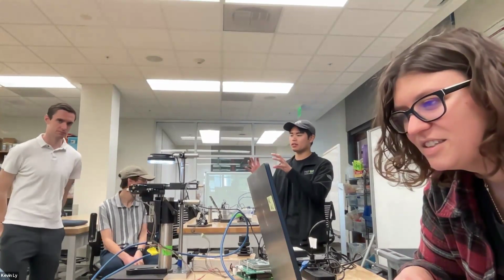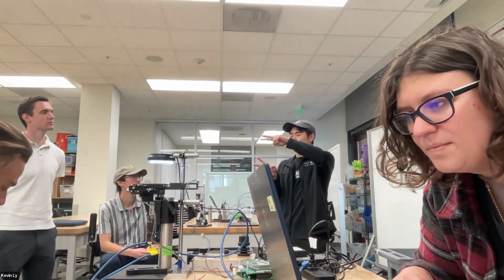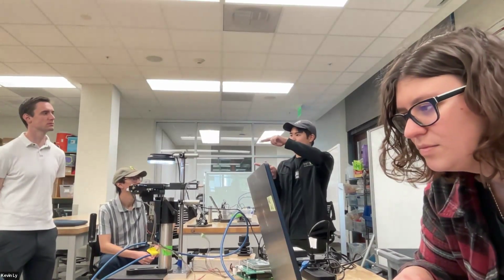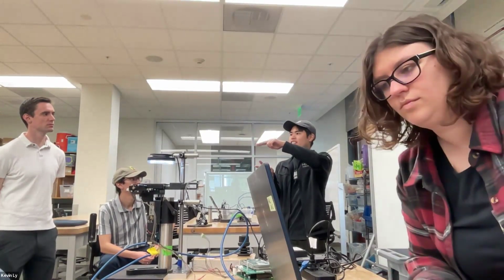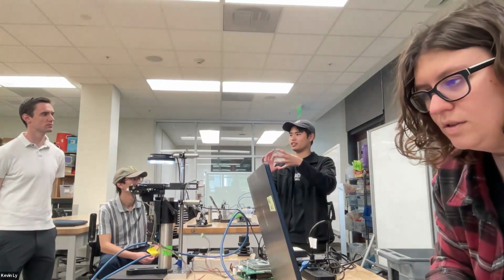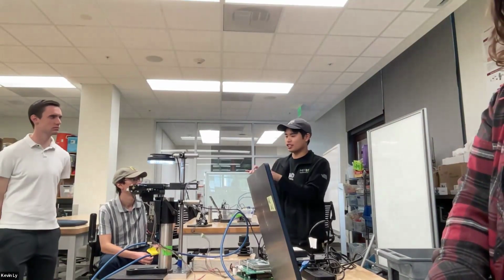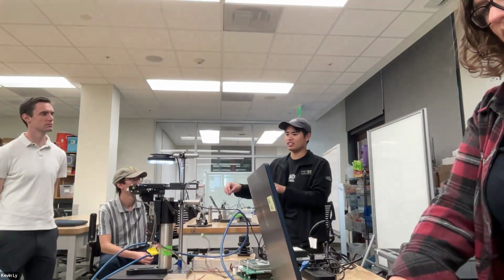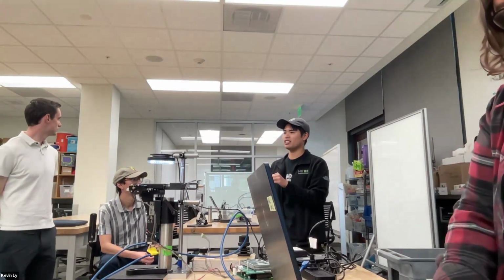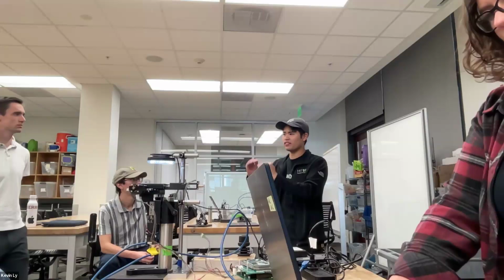A stepper motor involves like four wires, and you have to alternate pins rapidly and in a certain sequence to make the magnets move relative to each other. If you were to code that on a computer to send signals to the motor, it'd be very tedious, because it'd be do this, then do this, then do this. So it's a lot of instruction.